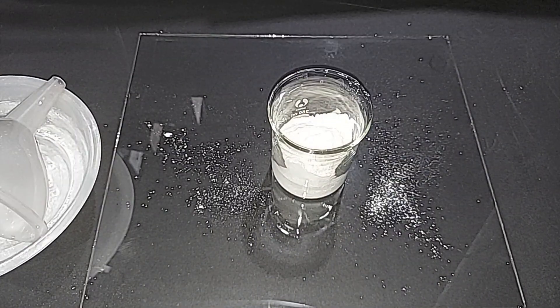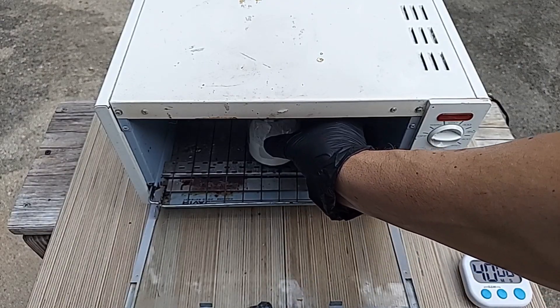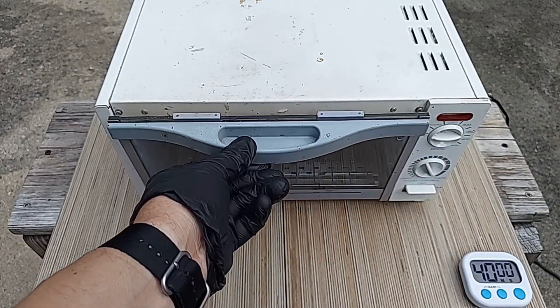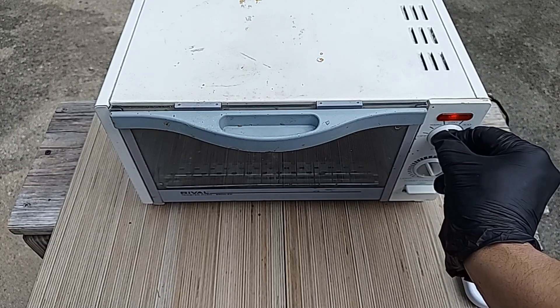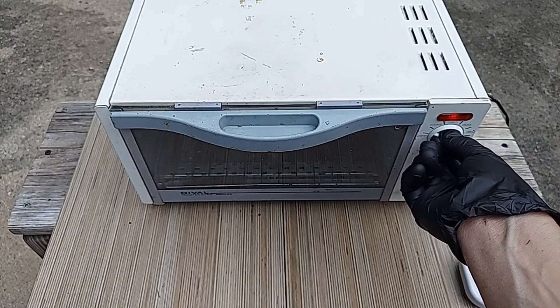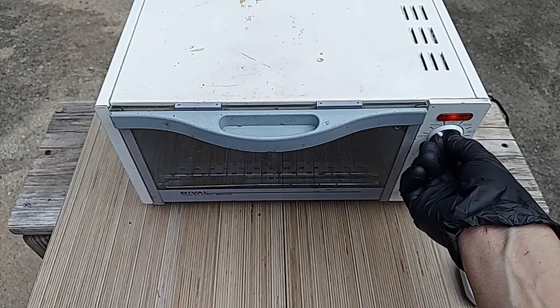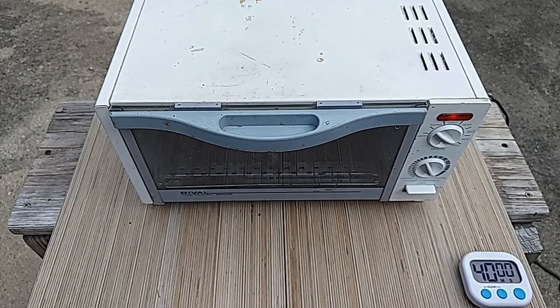It's finally done. I'm outside here with my toaster oven. 230 degrees Celsius is 446 degrees Fahrenheit, as I mentioned, and this goes up to 450. So that is really good. Four degrees above, but I don't think that's going to make a difference. And we'll start our timer.